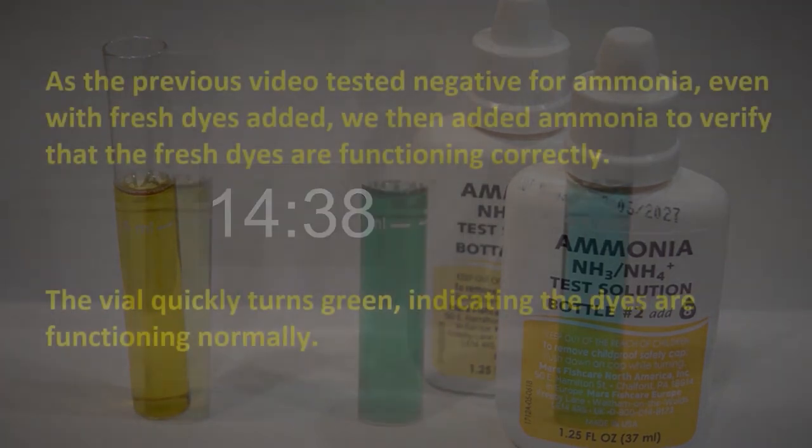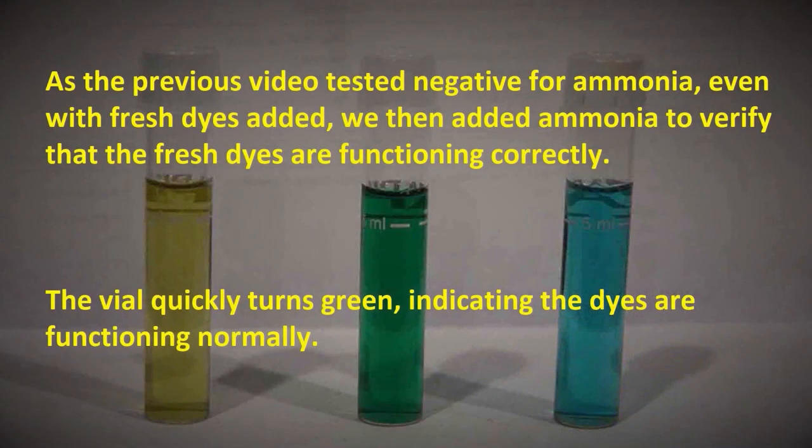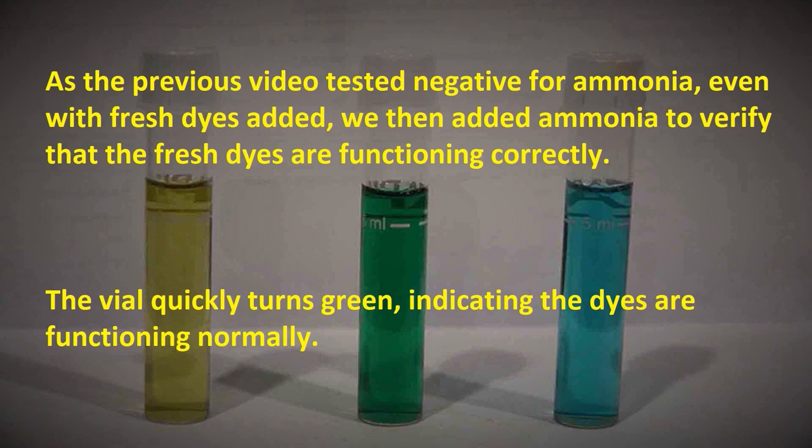As the previous video tested negative for ammonia, even with fresh dyes added, we then added ammonia to verify that the fresh dyes are functioning correctly. The vial quickly turns green, indicating the dyes are functioning normally.